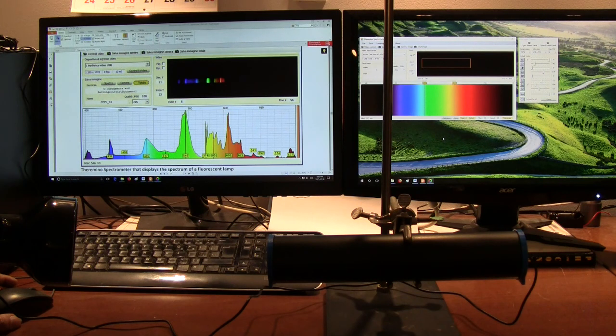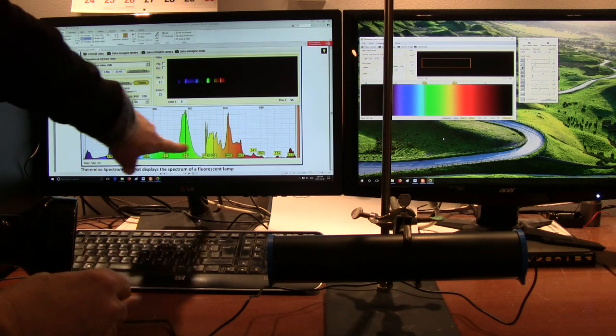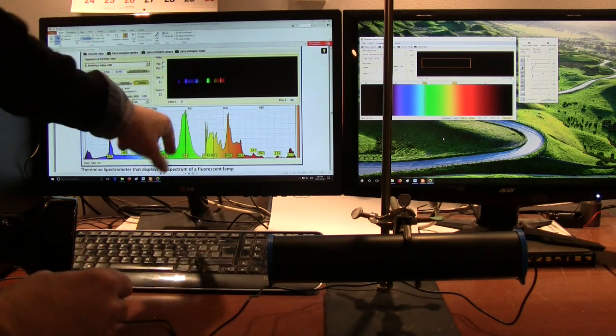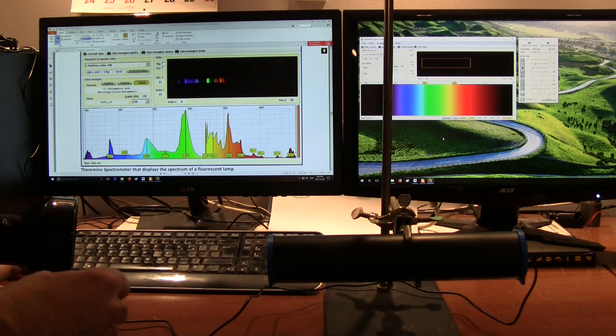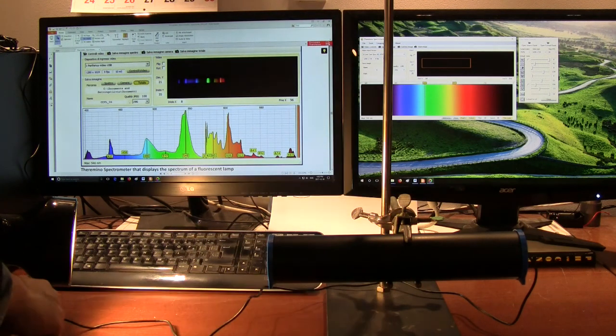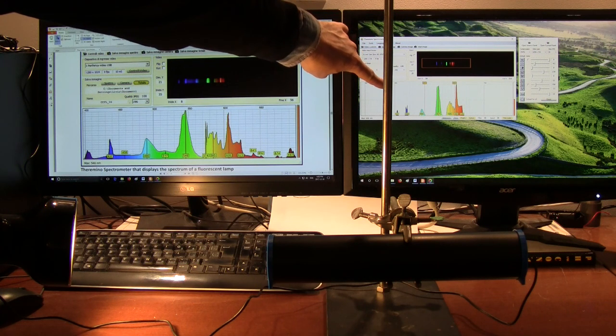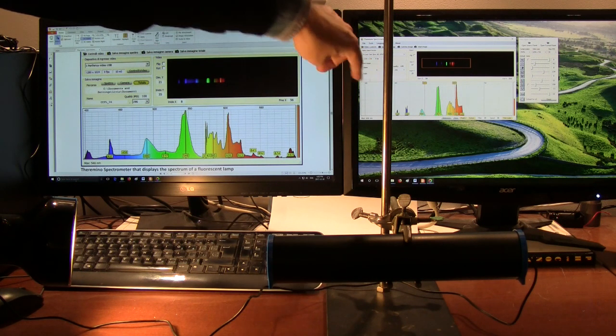So Theremino, one of the samples that they recommend using is this spectrum of a fluorescent lamp, and they give an example here in one of their PDFs, and we're going to use this one to calibrate our device. So they recommend calibrating to this green line, which is 546, and this blue line, which is 437. And we've got our actual live spectrum here. I haven't turned the lamp on yet, but when we turn the lamp on, we immediately get the spectrum of the fluorescent light, which is in and around this same range.